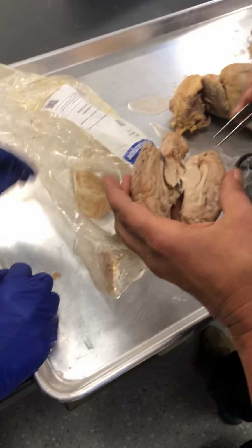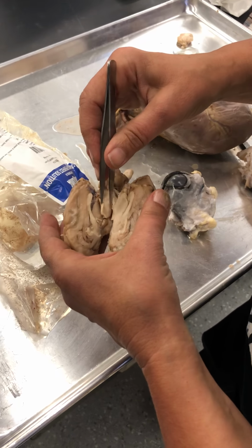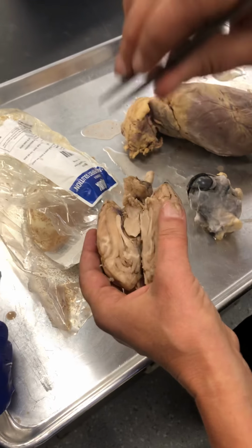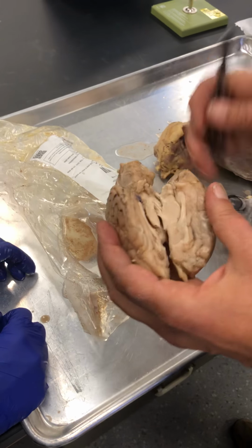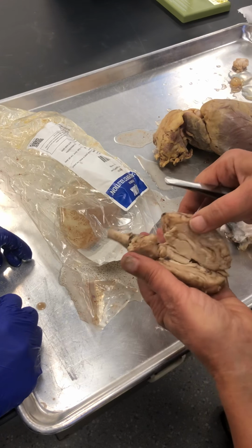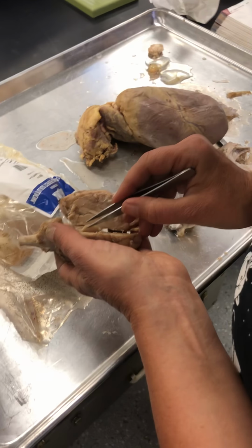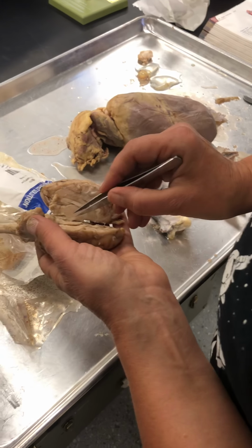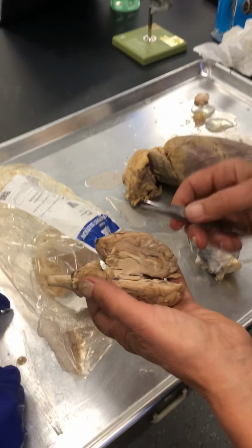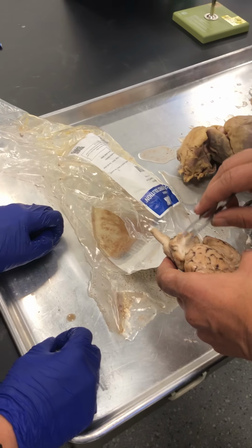Isn't this the thalamus? This whole big thing here, and over there too, and the third ventricle is around it. Yeah, it's the wall of the third ventricle. So other than that thalamic adhesion, the two sides would be disconnected, but because of where you cut it, you're not seeing that. Which is fine, that's not a complaint, you never know exactly where you're going to cut it. You can see the arbor vitae here, nicely.